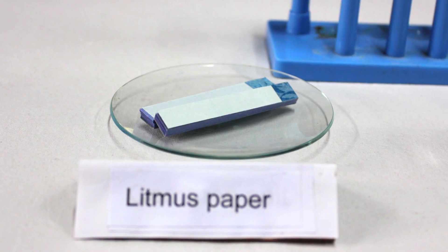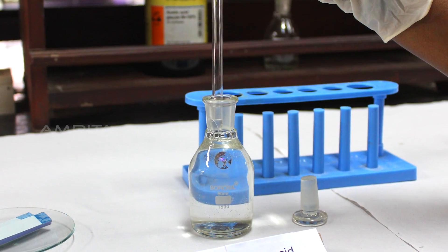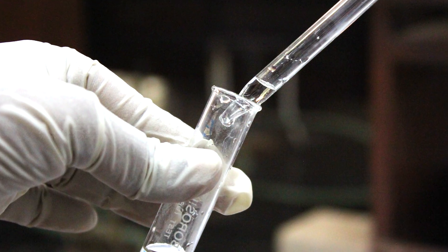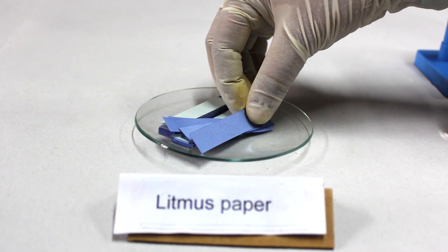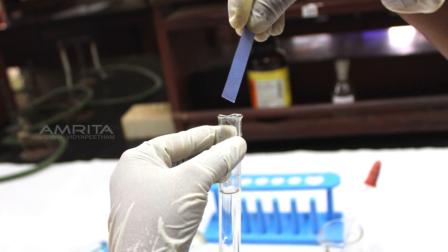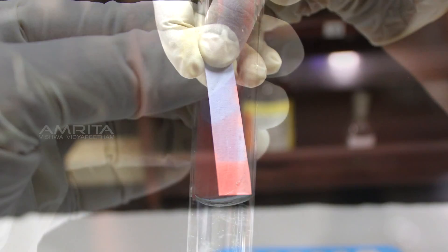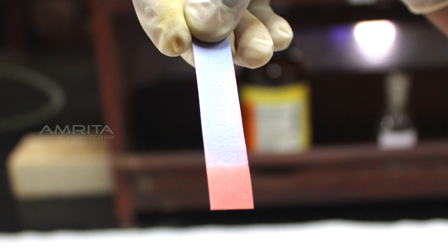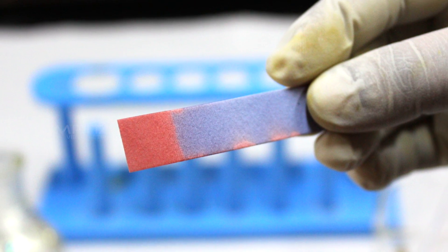To test the effect on litmus, pour a few drops of acetic acid into a test tube using a dropper. Take a blue litmus paper and dip it in the test tube containing the solution. You can see that blue litmus turns red, which indicates that it is acidic in nature.